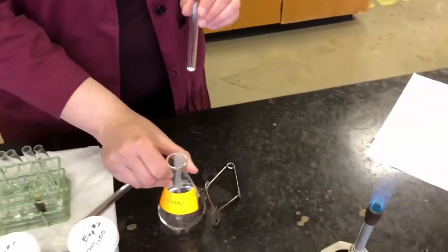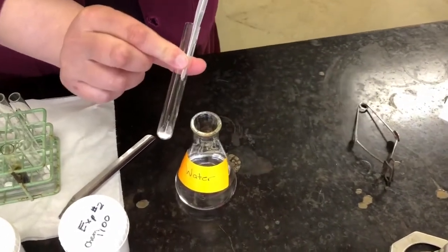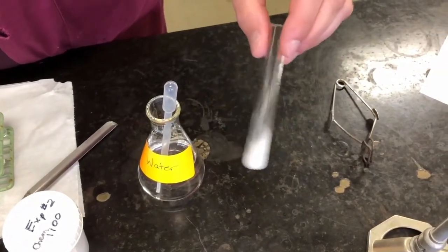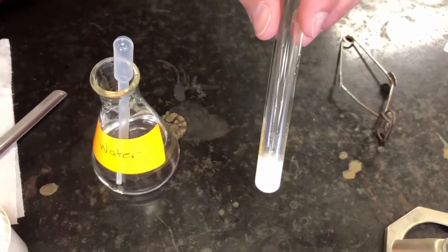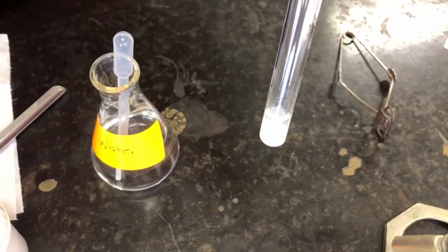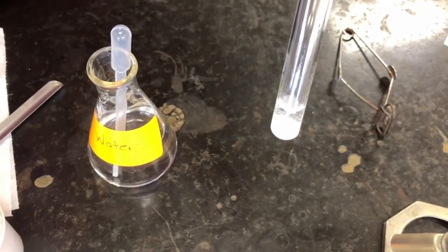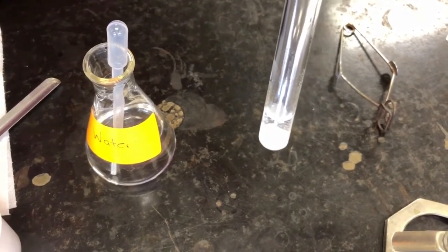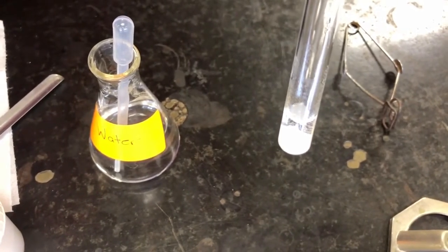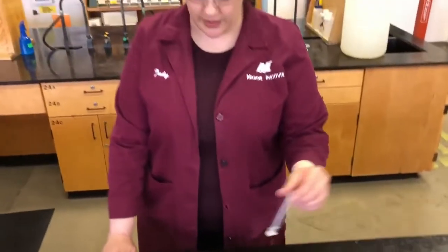So let's take our water again. We'll add some water to it. Let's see if it dissolves. Give it a little shake. And as we saw with the chalk, it's not actually dissolving, it's just settling again to the bottom. So this test would also confirm that it looks to be chalk. Okay, so not soluble in water, so insoluble.